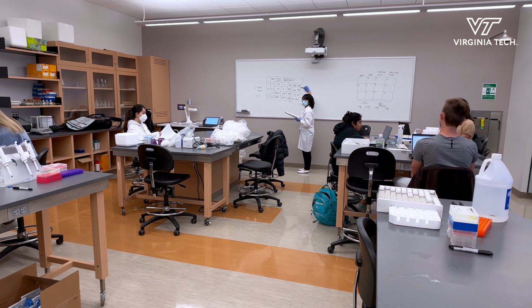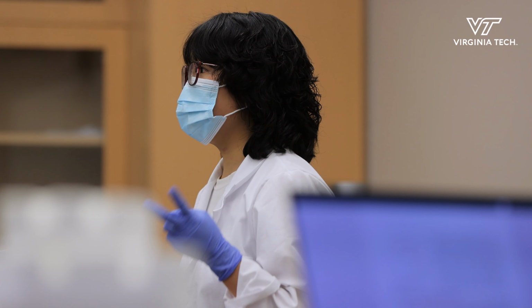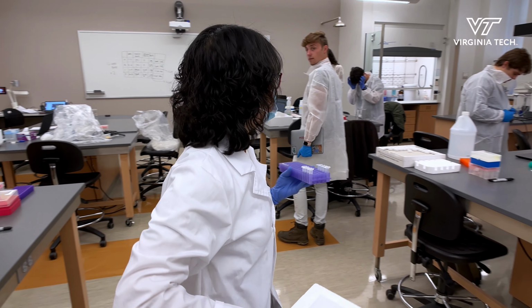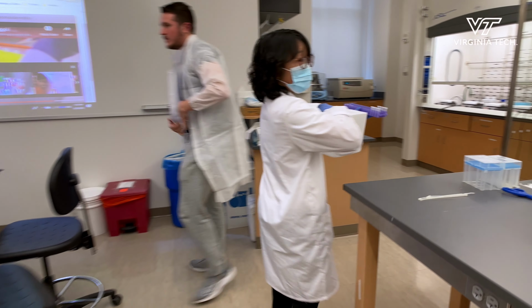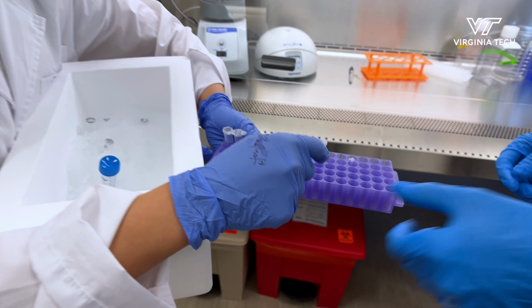It's a combination of biology, chemistry, material science, physics, and that's why this program is within the Academy of Integrated Science. We're trying to bring state-of-the-art research into our teaching, and we are always reviewing our lab modules every year so that the students are keeping up with the research, with the application that is currently on the market or even at the front of the research. Here is your plasmid mixture.